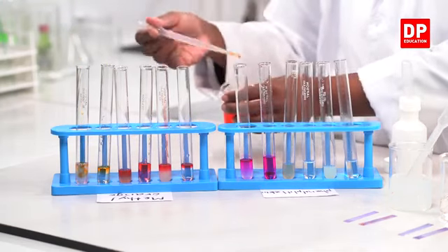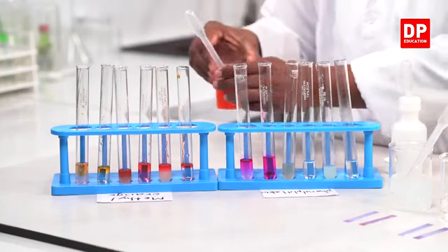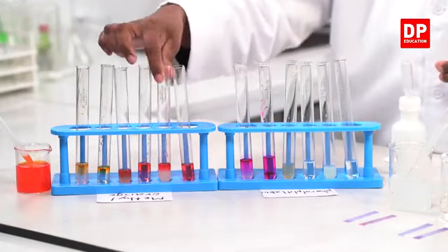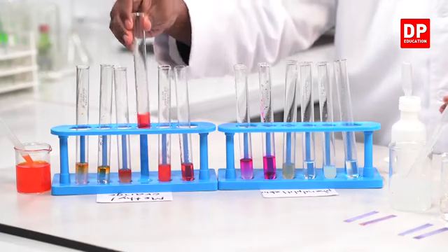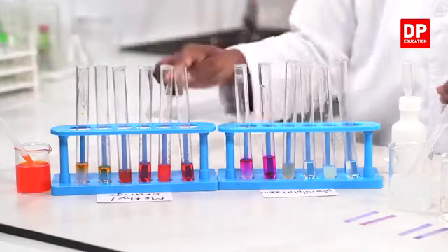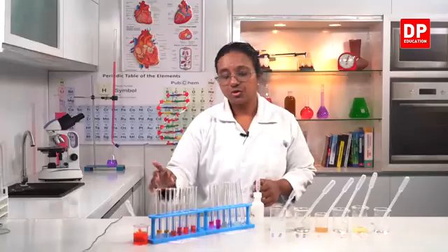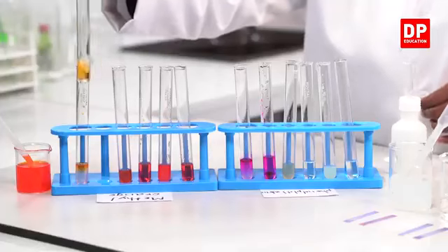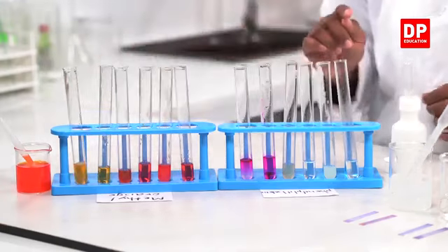So now here students, when I mix it, you can see the color changes. So now with the acids, can you all see the color? From orange, it has turned to red. Actually, it looks like pink or pinkish red. So normally we say from orange, it turns to red in acids. So methyl orange gives yellow color with bases but turns red with acids.